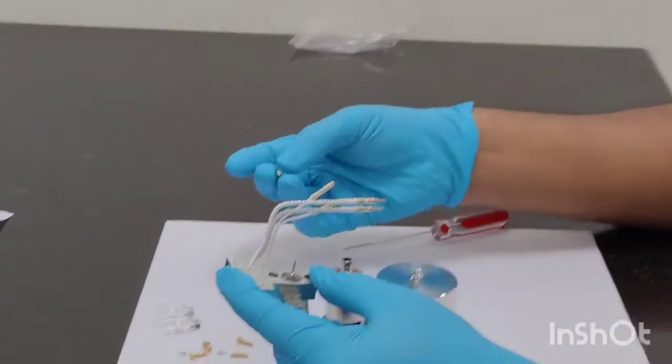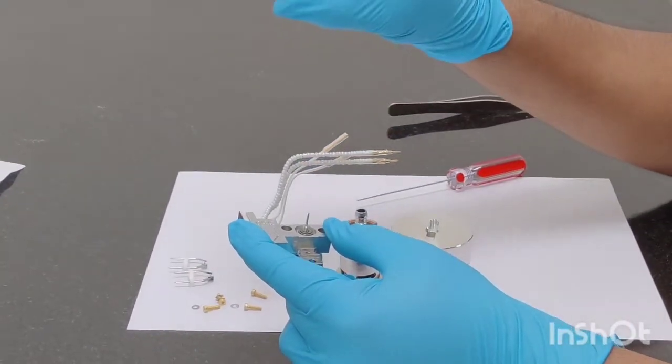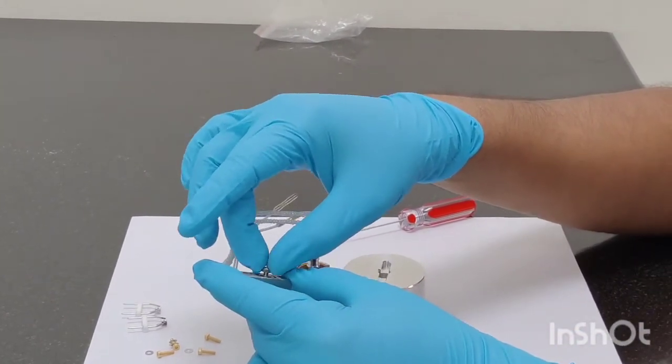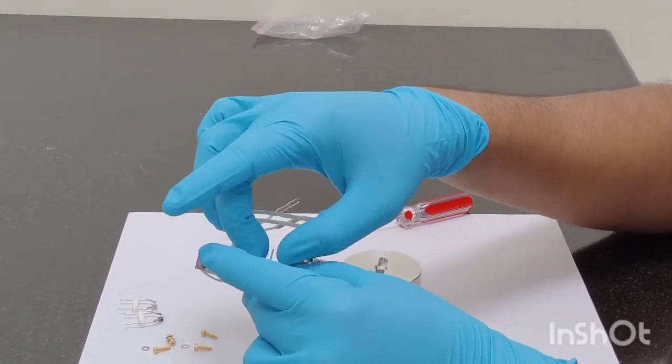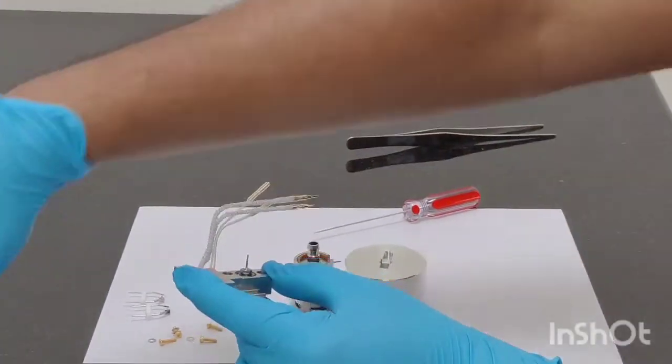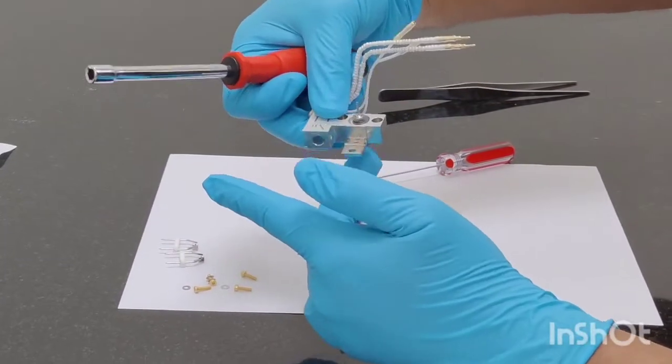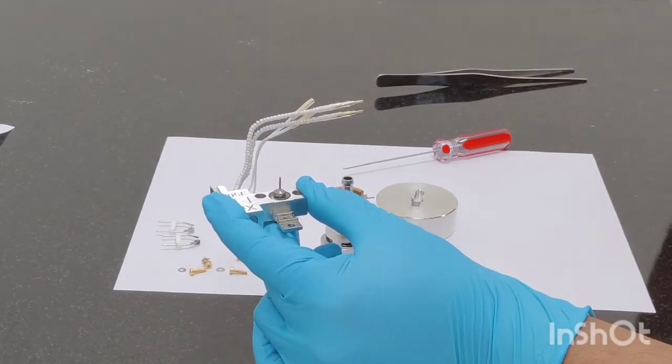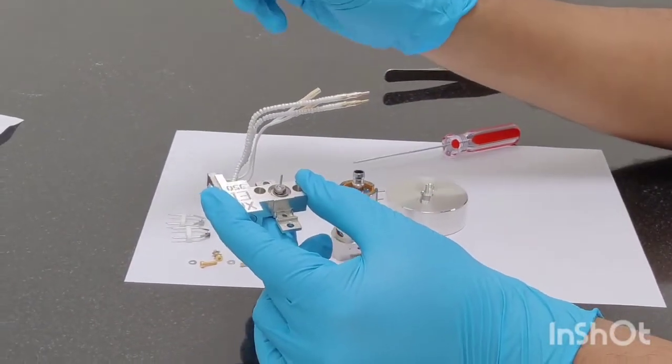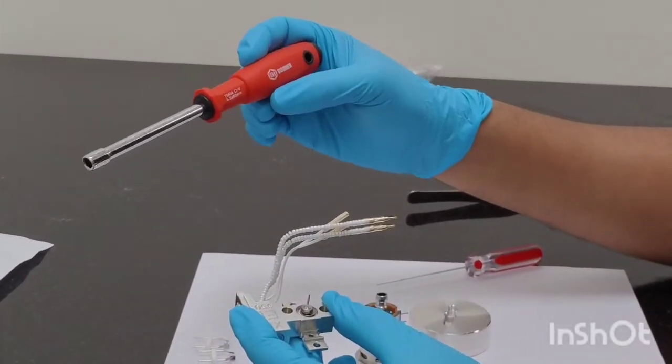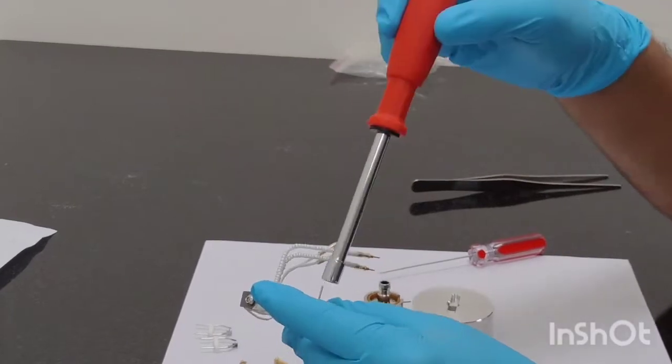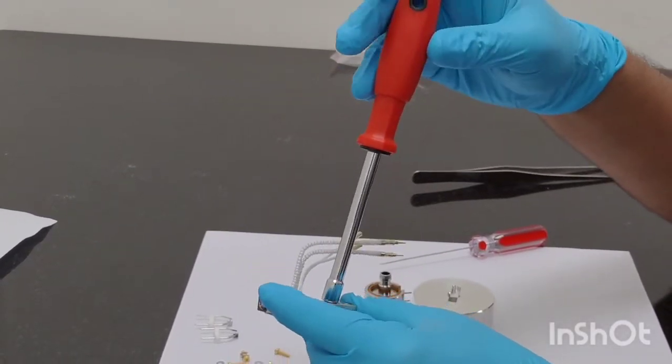Fixing these o-rings, this is a screw which needs to be placed above it. Just hand tight it. You can see with one finger I was holding the repeller and using the other hand I have tightened this screw. Now using this screwdriver which is your 5.5 mm, so we have to tighten this, but remember we don't have to over-tighten it.